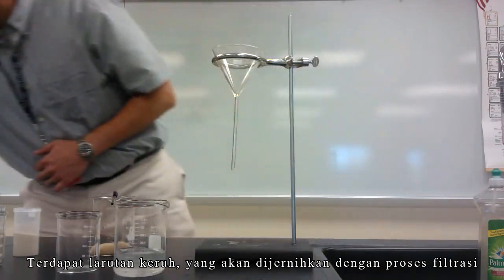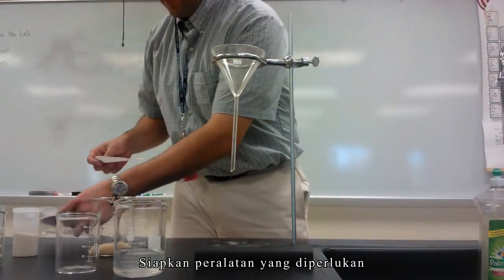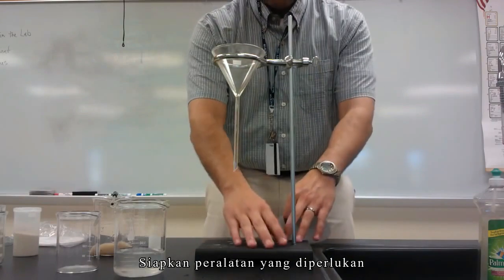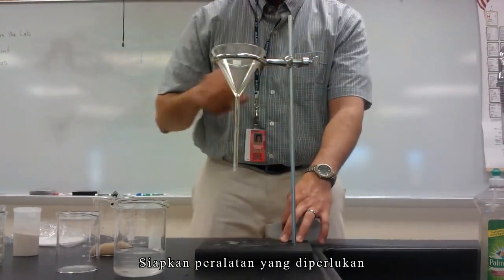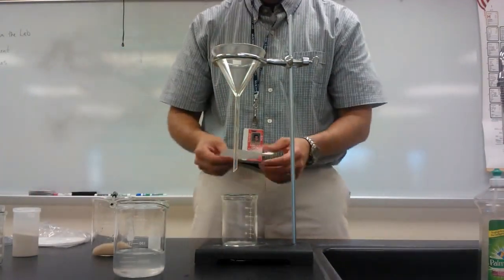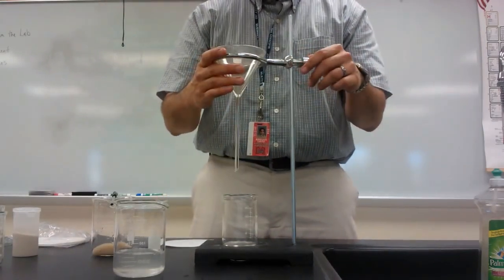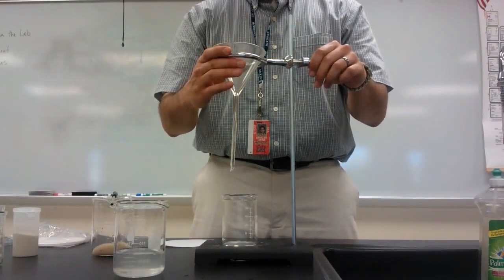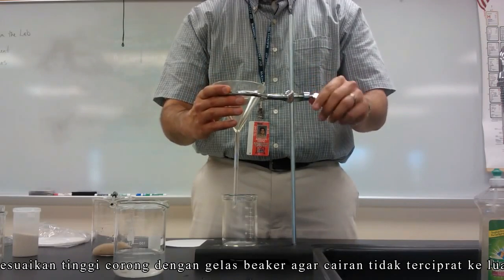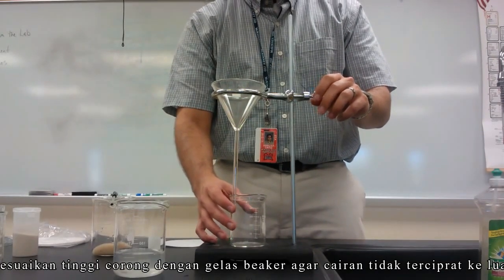To filter, we're going to use a setup with some filter paper. We've got our glass funnel right here. Notice that I've got my ring stand with my ring hooked up to it. I have a beaker to hold my liquid in, and I've got a filter paper. I'm going to adjust my setup — I'll bring down my ring so that the funnel is slightly in the beaker, and then place the beaker so that the funnel is touching the wall of the beaker.